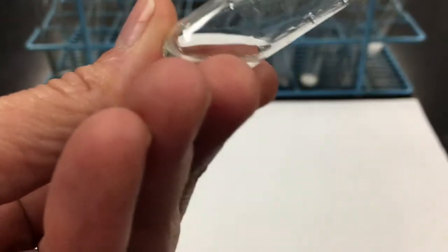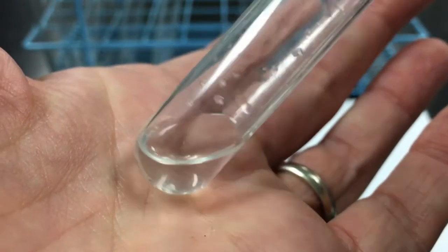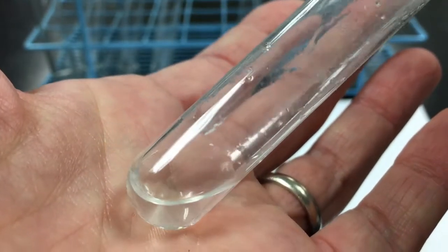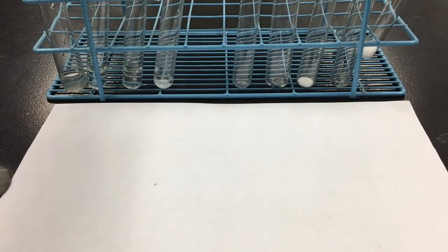I'm not feeling any substantial temperature differences, and it looks like most of the solid has disappeared, so it looks clear and colorless, like the way liquid 2 does look. And when I smell, it does still smell like the strong smell that chemical 2 has.